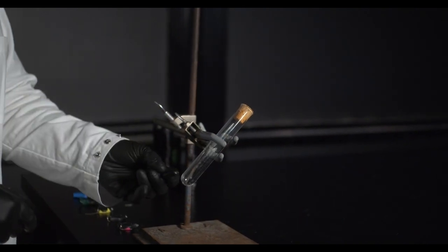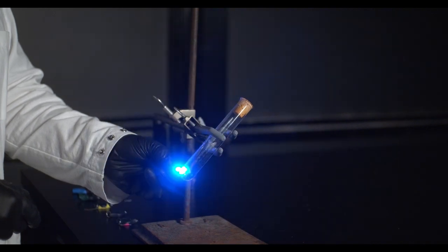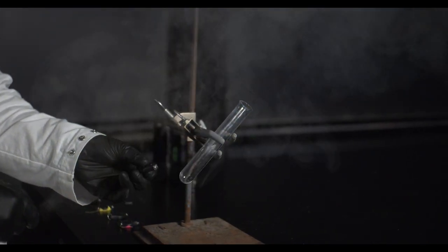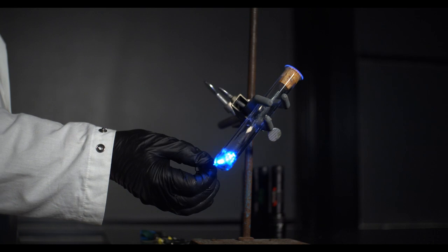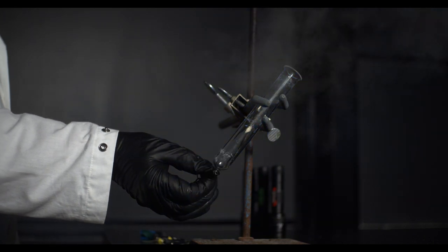And finally, ultraviolet. And we see that the ultraviolet light causes an almost immediate reaction.